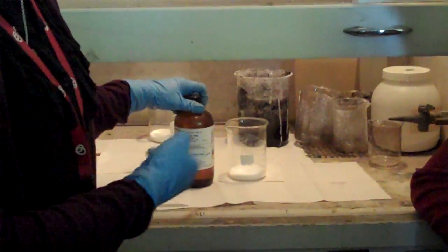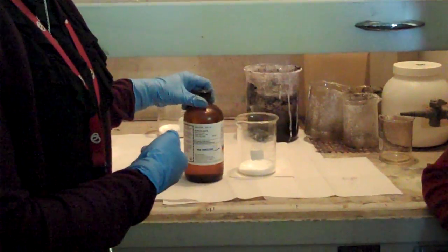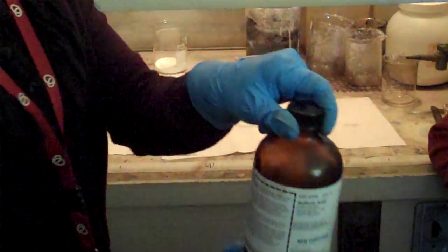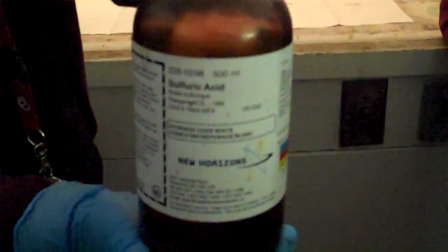And what our catalyst is, now this is, yes, this is a very dangerous chemical. Sulfuric acid. What if you drink it? Sulfuric acid. You can try it. Absolutely not, you cannot try it.